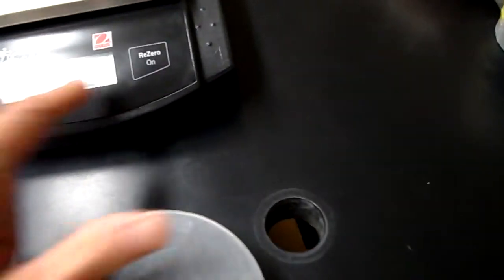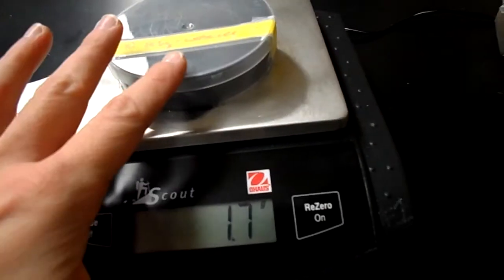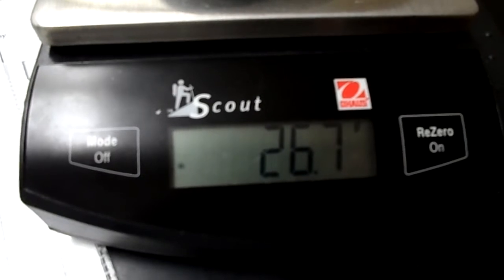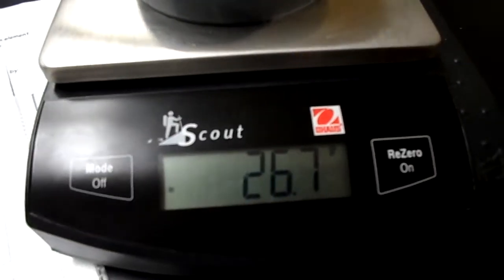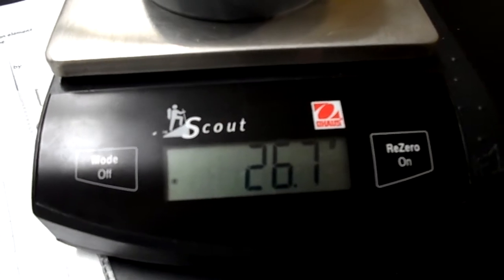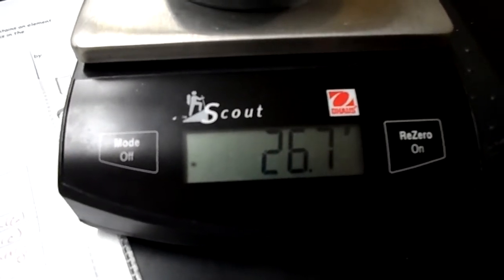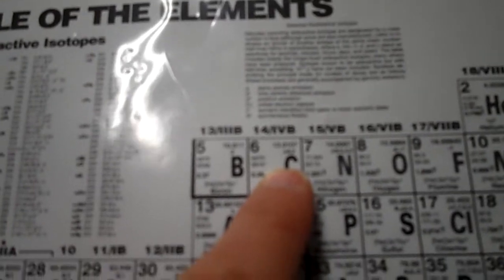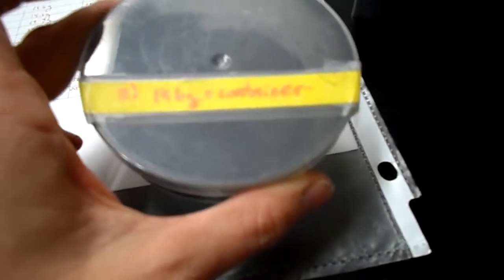Now the second element. The mass of the container is 14.6. The entire container plus the element you can see on the scale is 26.7. So what you need to do is take 26.7 and subtract out the weight of the container, which is 14.6. And your answer should be somewhere around 12 for a value. I'm not telling you exact, you have to figure it out. So what is inside of here? Which element is it? You have to look on the periodic table, and if you look under carbon, I see 12.0107 for its mass number, so that is correct. The element inside of here is carbon.